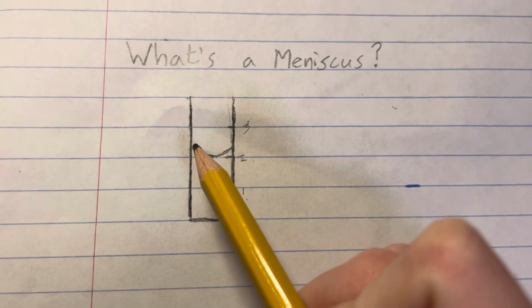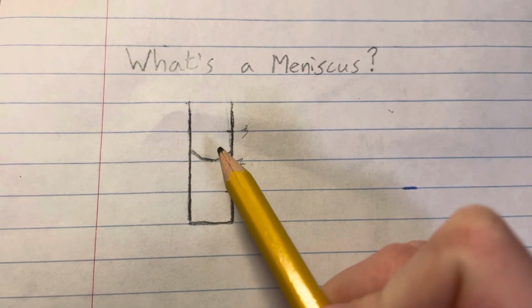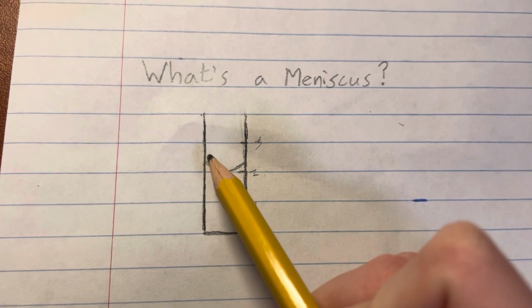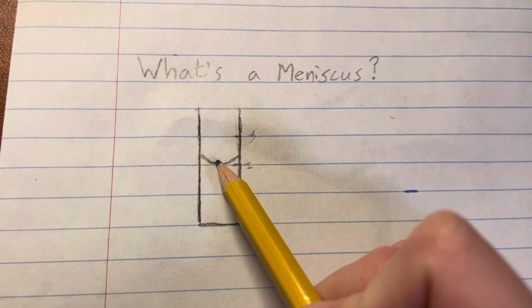The water molecules will be attracted to the molecules that are in this wall. And because these molecules of the solution, the water, are attracted to each other and they have polar bonds, the water molecules will still be attached to these molecules that are attracted to the wall. So it'll just be higher near the walls, and then it'll fall towards the center.